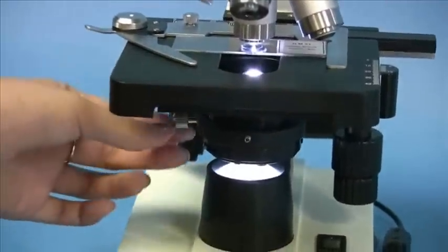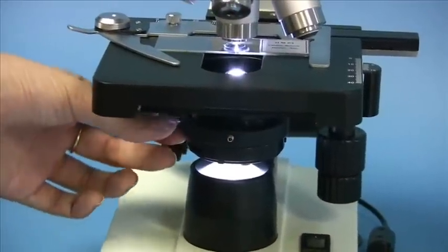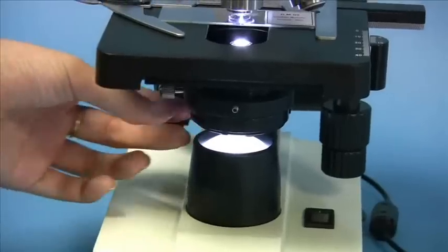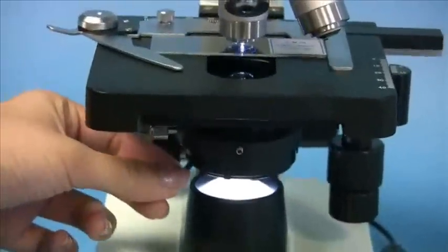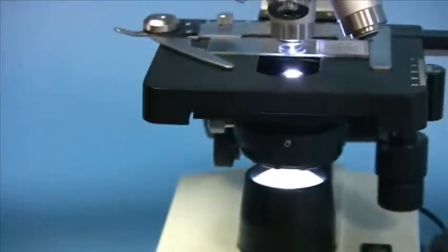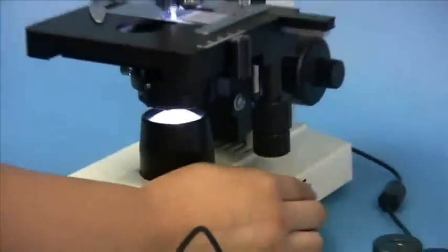You can also change the size of the aperture by moving the aperture diaphragm. And finally, the brightness using the intensity dial.